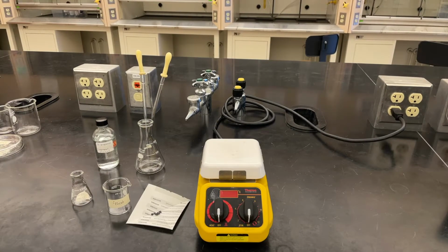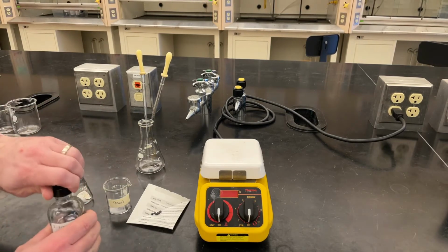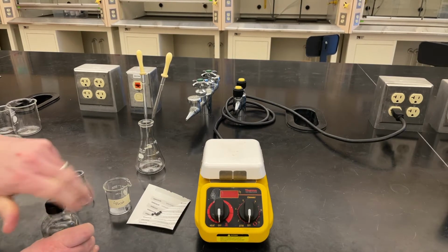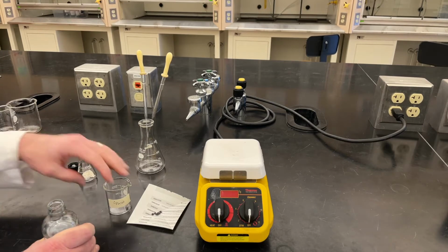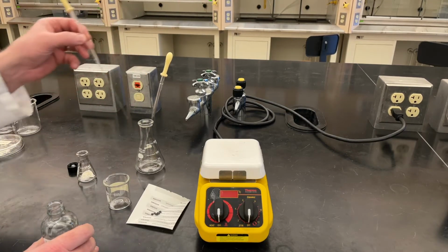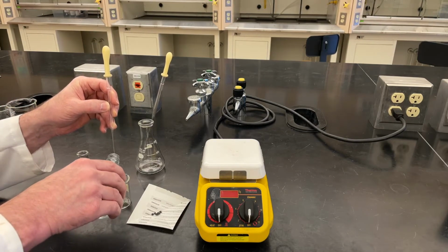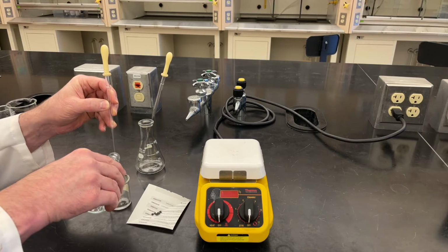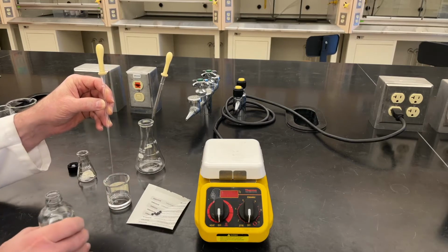All right, we're going to do the recrystallization now. In order to do that, we need some 2-propanol. The amount that we're going to need is probably not more than a couple of mils, but because I'm going to have to heat this up and boil it, I'm just going to transfer about 10 mils, maybe 15, pouring it down the pipette, using the pipette to help assist in pouring so I don't lose any.